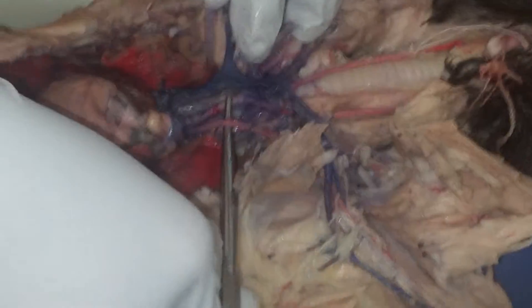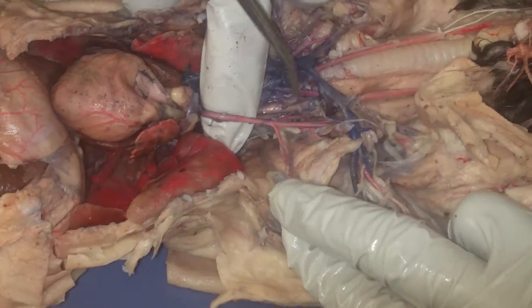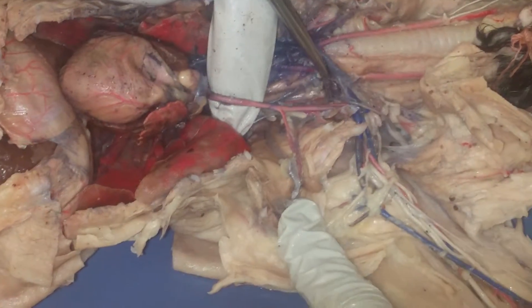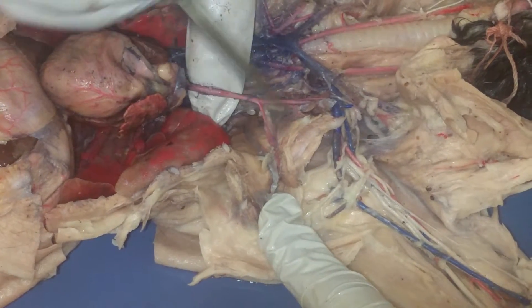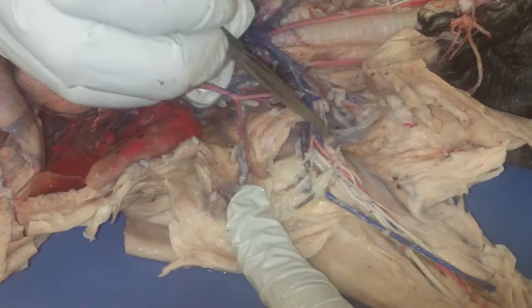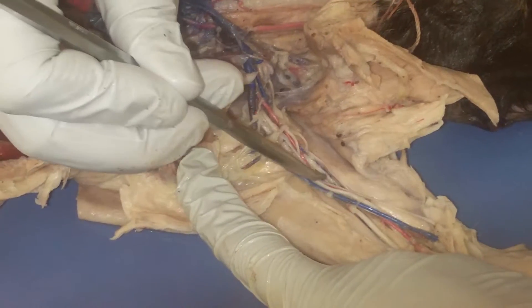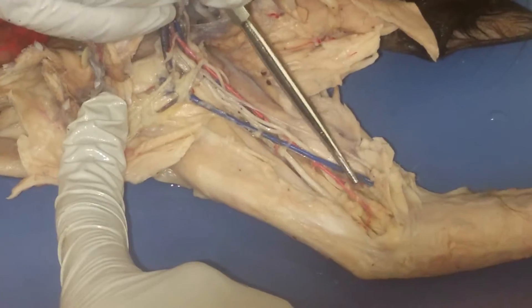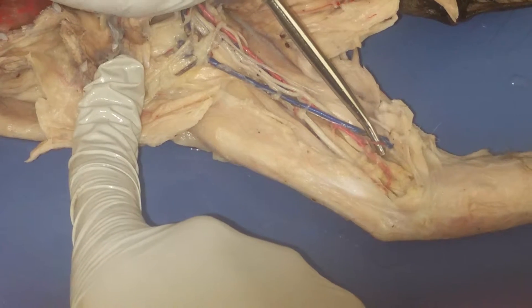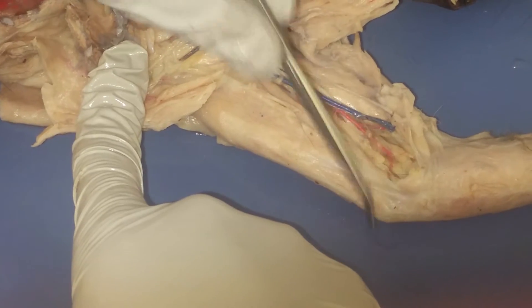The other branch is going to be your left subclavian. There's your three branches again, your internal mammary. Once the subclavian comes up here and enters into the arm it becomes the axillary. Then once it comes into the bicep, it becomes the brachial. Keep following it and it's going to bifurcate again — one going towards the radial side, so that's your radial, and one going towards the ulnar side, so that's the ulnar.